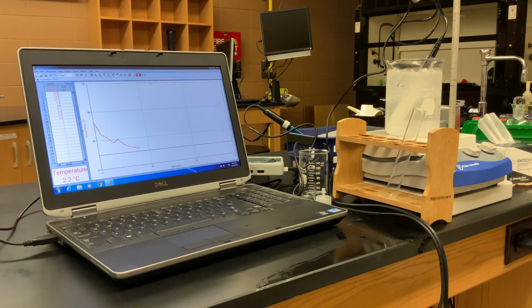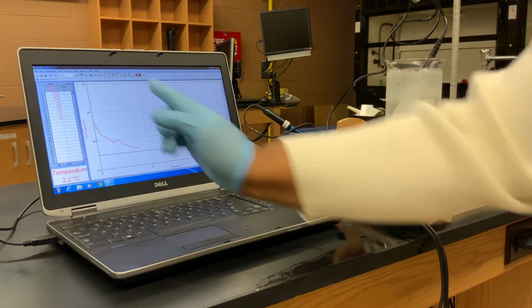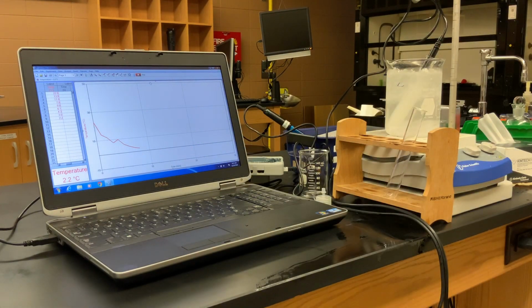And so, if it wasn't for that little 9.8 degree spike there, there's our little spike in our graph, we would have had a pretty smooth curve other than that little spike there. But we can kind of ignore that. That's not really the part that we're interested in. We're interested in when the curve starts to flatten out and when our temperature stops changing. So when our temperature stops changing, that final temperature is going to be our freezing point for our biodiesel. So we're still going down a little bit. We're at 1.6.